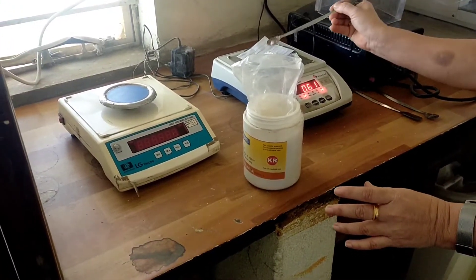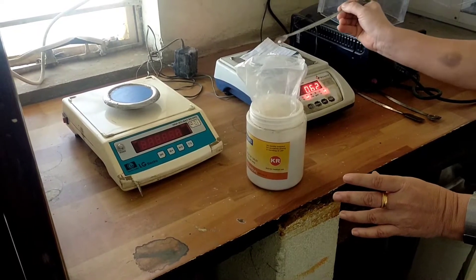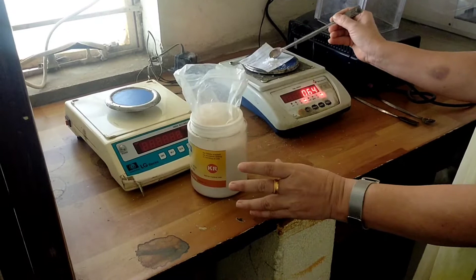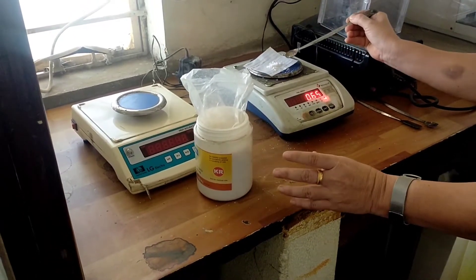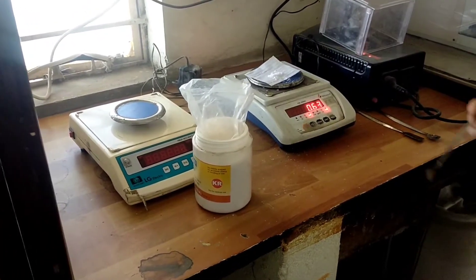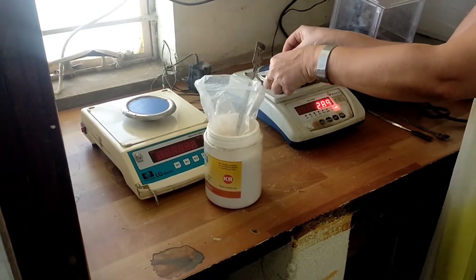Okay, so approximately 0.63 grams. This is 0.63 grams of oxalic acid.